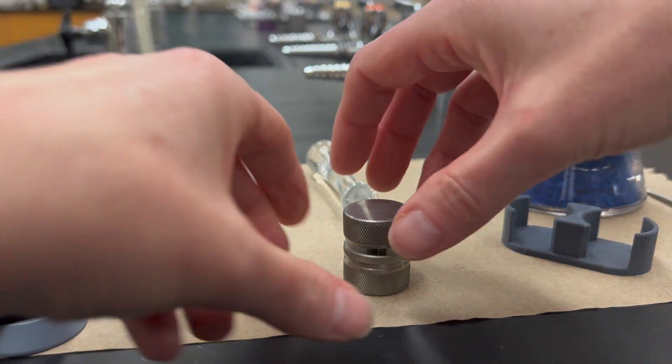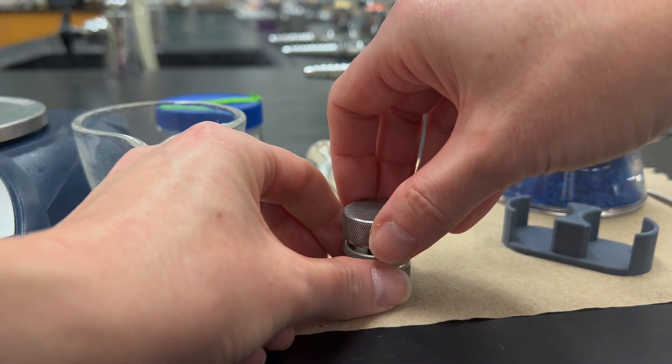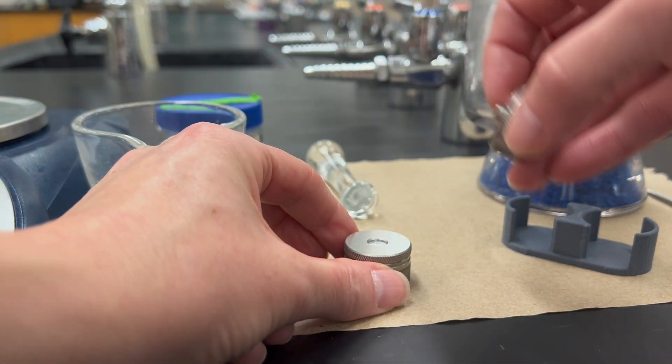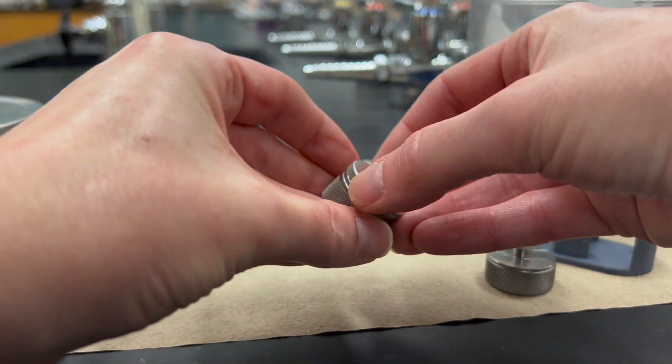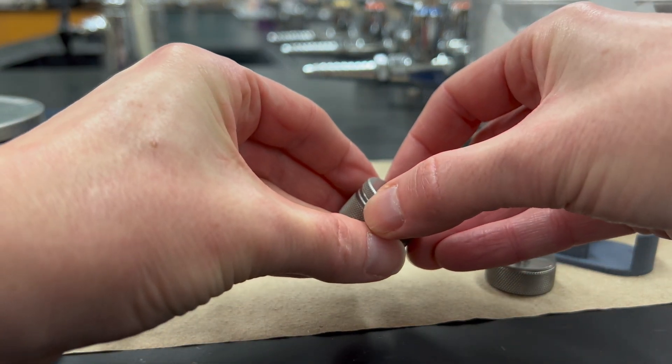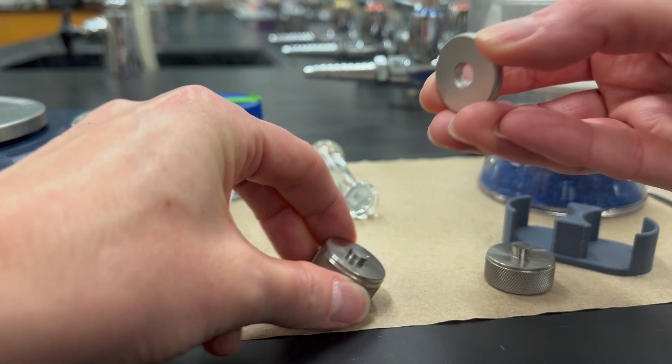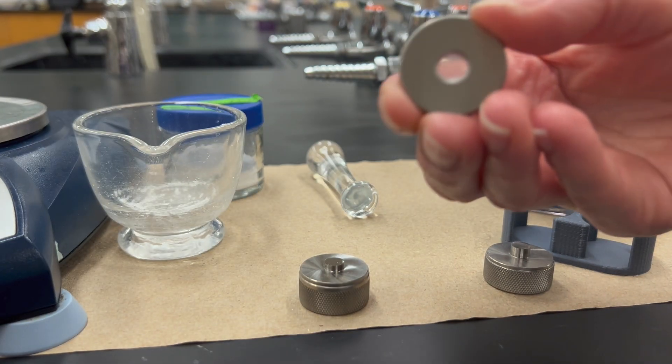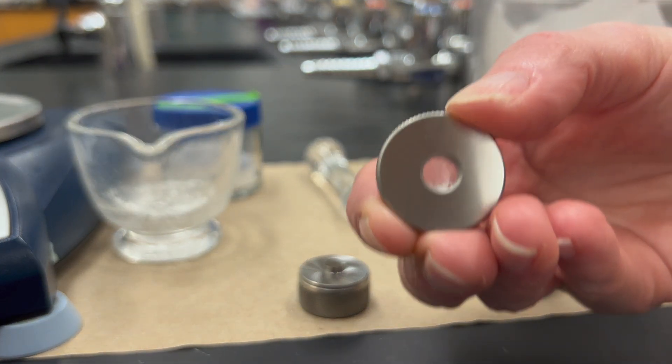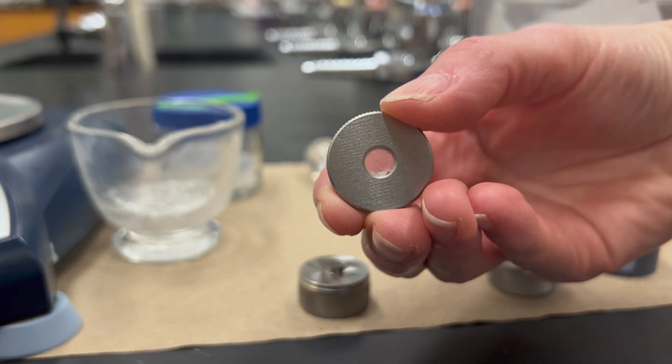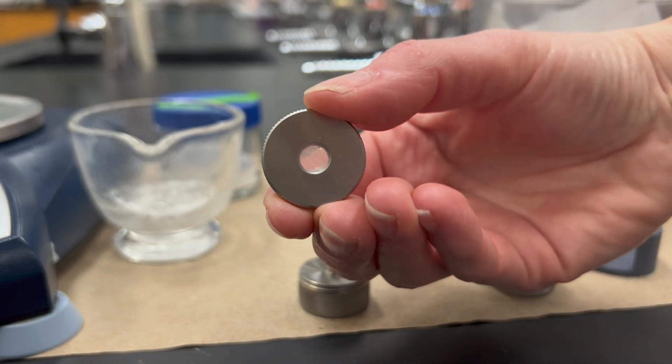So here you want to do this delicately—you're going to carefully take off this top. The KBR pellet is going to be a little fragile, and you carefully pull out that middle part, kind of just wiggle it. So here we go, here is our KBR pellet. It's semi-transparent; you can see light going through it, you can see my hand behind it.